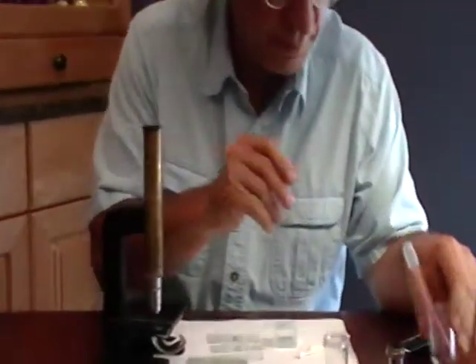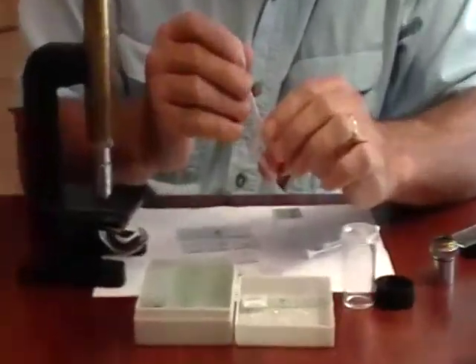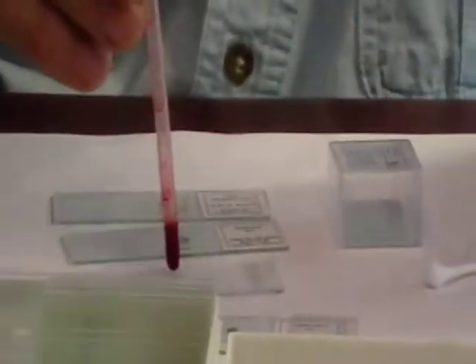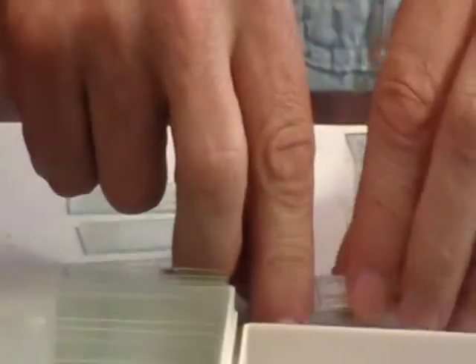You can see it's very easily broken. But if you wanted to do blood — and you happen to have some — this is corn syrup, food dye, and water. You would take your material, one drop at a time, put it in the center of the slide, take your cover glass, and drop it on top. It doesn't take much because there are two extremely flat surfaces.